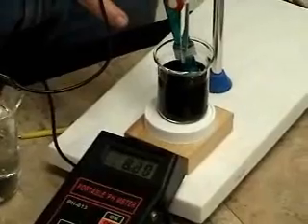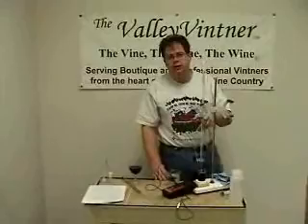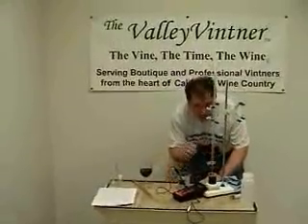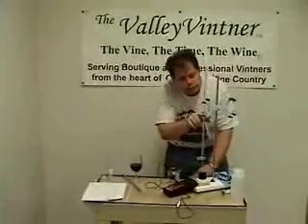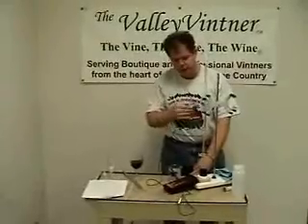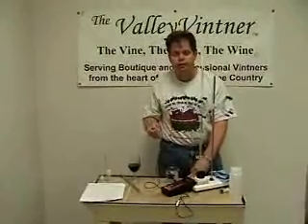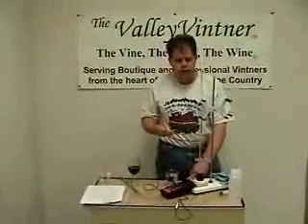And we're there. That's close enough — that's how it works. 8.2. Now we need to record the amount of sodium hydroxide consumed in the burette to reach a pH of 8.2. We started at 4.6 and we are now at 11.1. So we used 6.5 milliliters — or cc's — of sodium hydroxide to reach our pH of 8.2. That's 6.5 grams per liter.